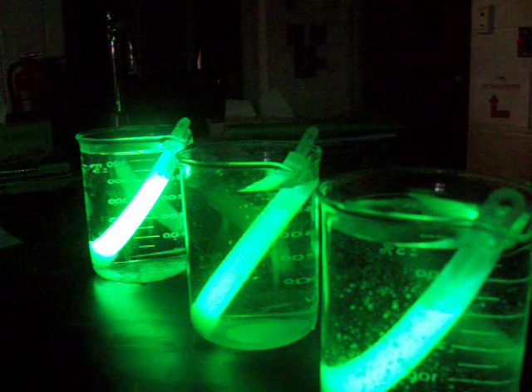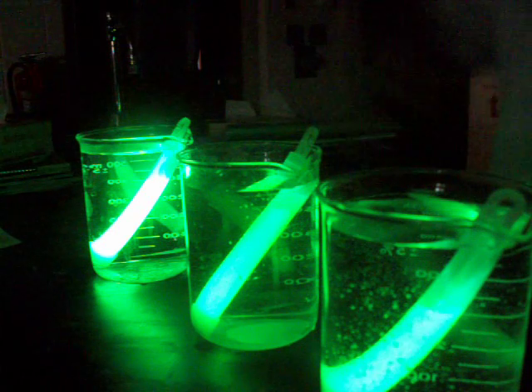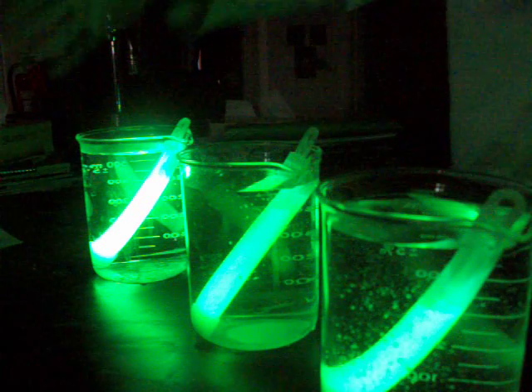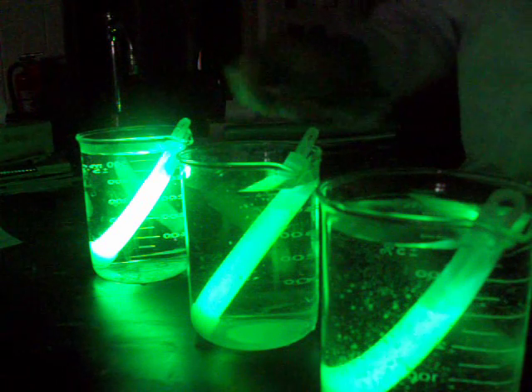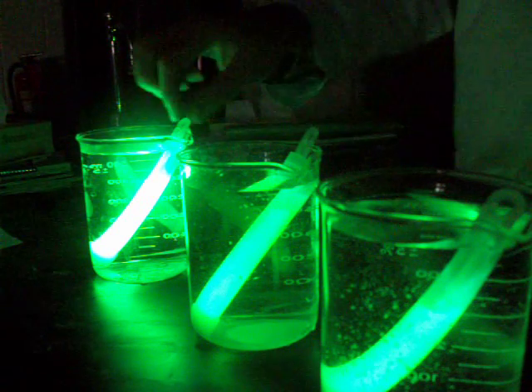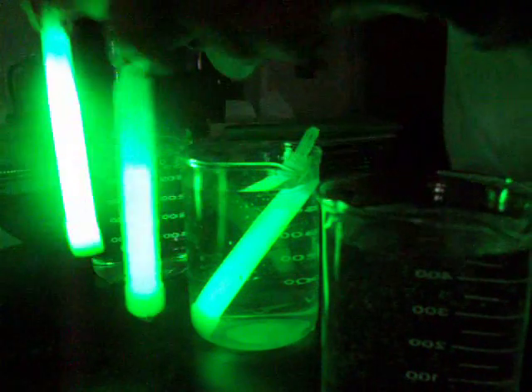So, already you can begin to see it. It's a little more dramatic on one end than it is on the other, but this one was the hot beaker. What do you notice? It's a lot brighter. Growing a lot brighter than the one that was in the cold.